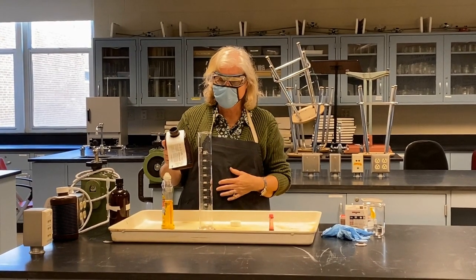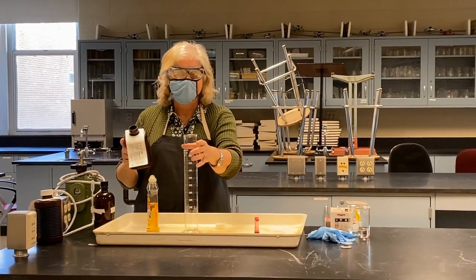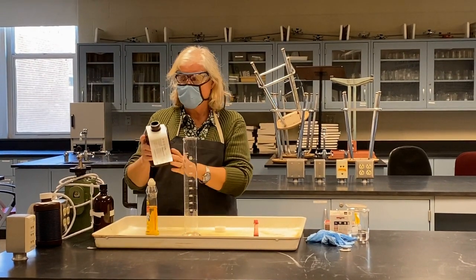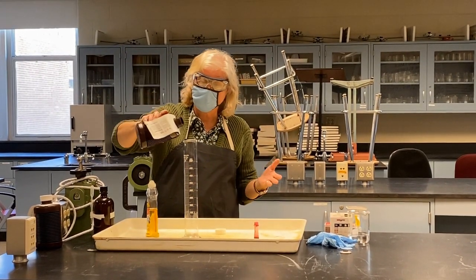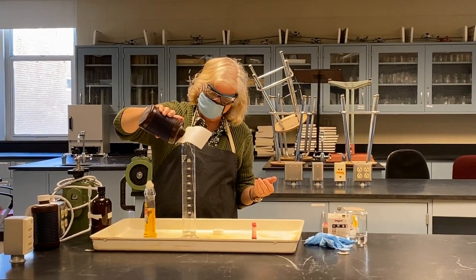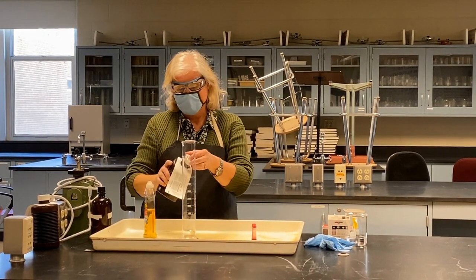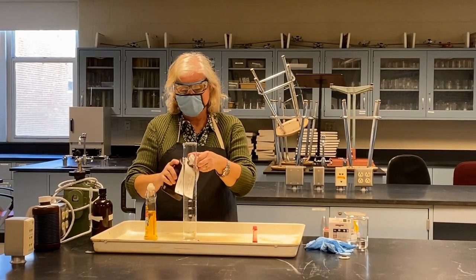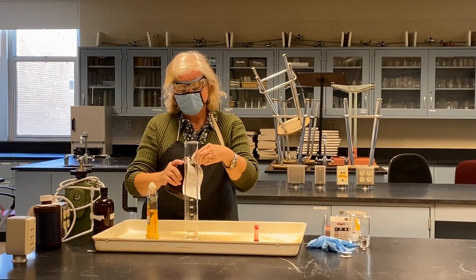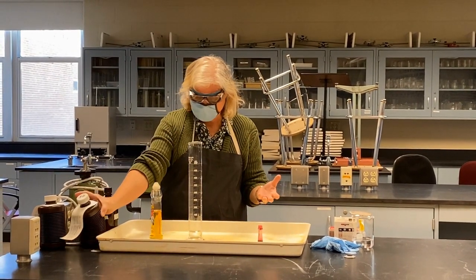Hello, I'm Dr. Mihalsik, and I'm here to show you a couple of demonstrations. This one you've seen a variation on already. So I'm going to take some concentrated hydrogen peroxide. I'm going to put it in this very large graduated cylinder. And as you can see, not much happens because hydrogen peroxide decomposes very, very slowly over time. So it just looks like nothing's happening.